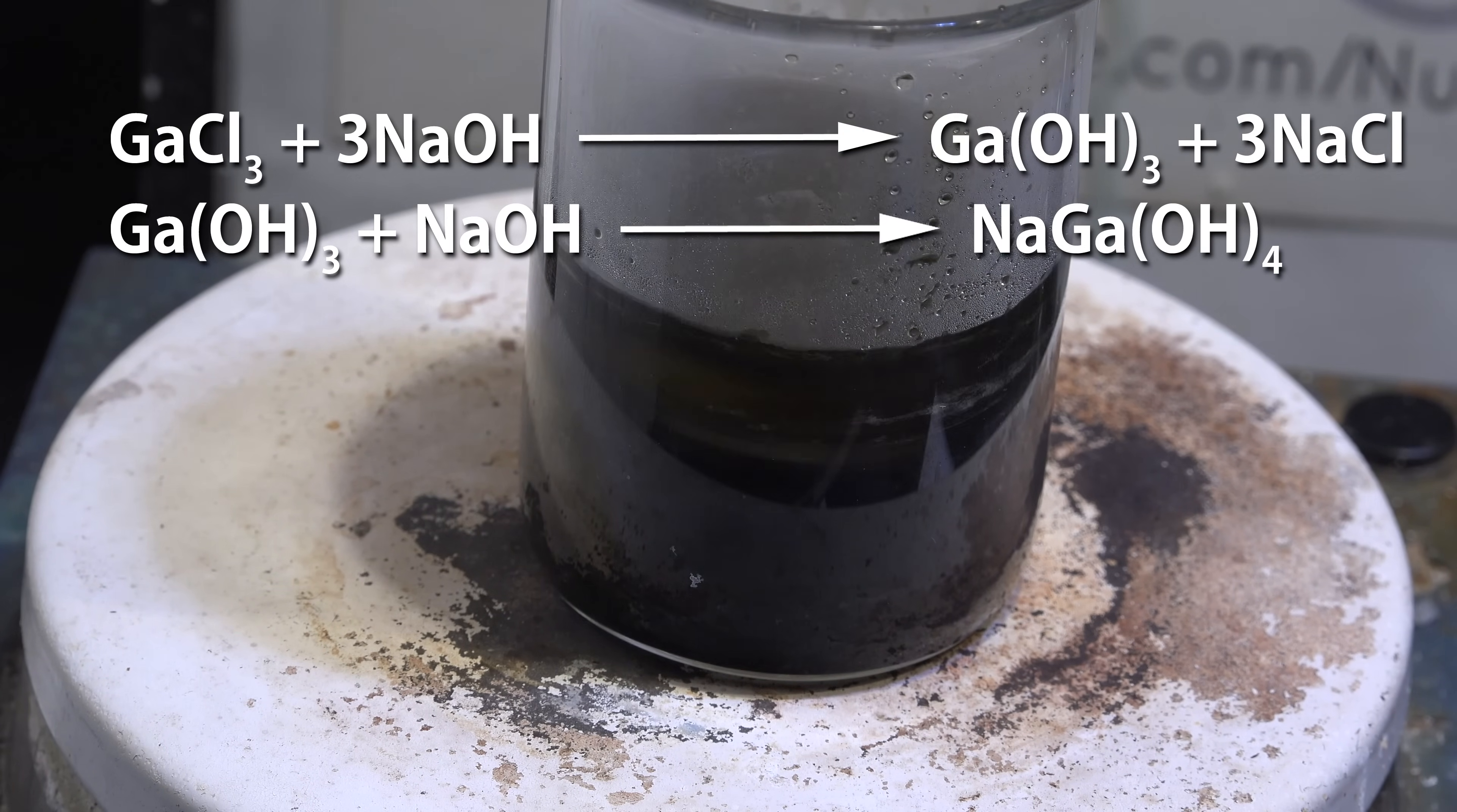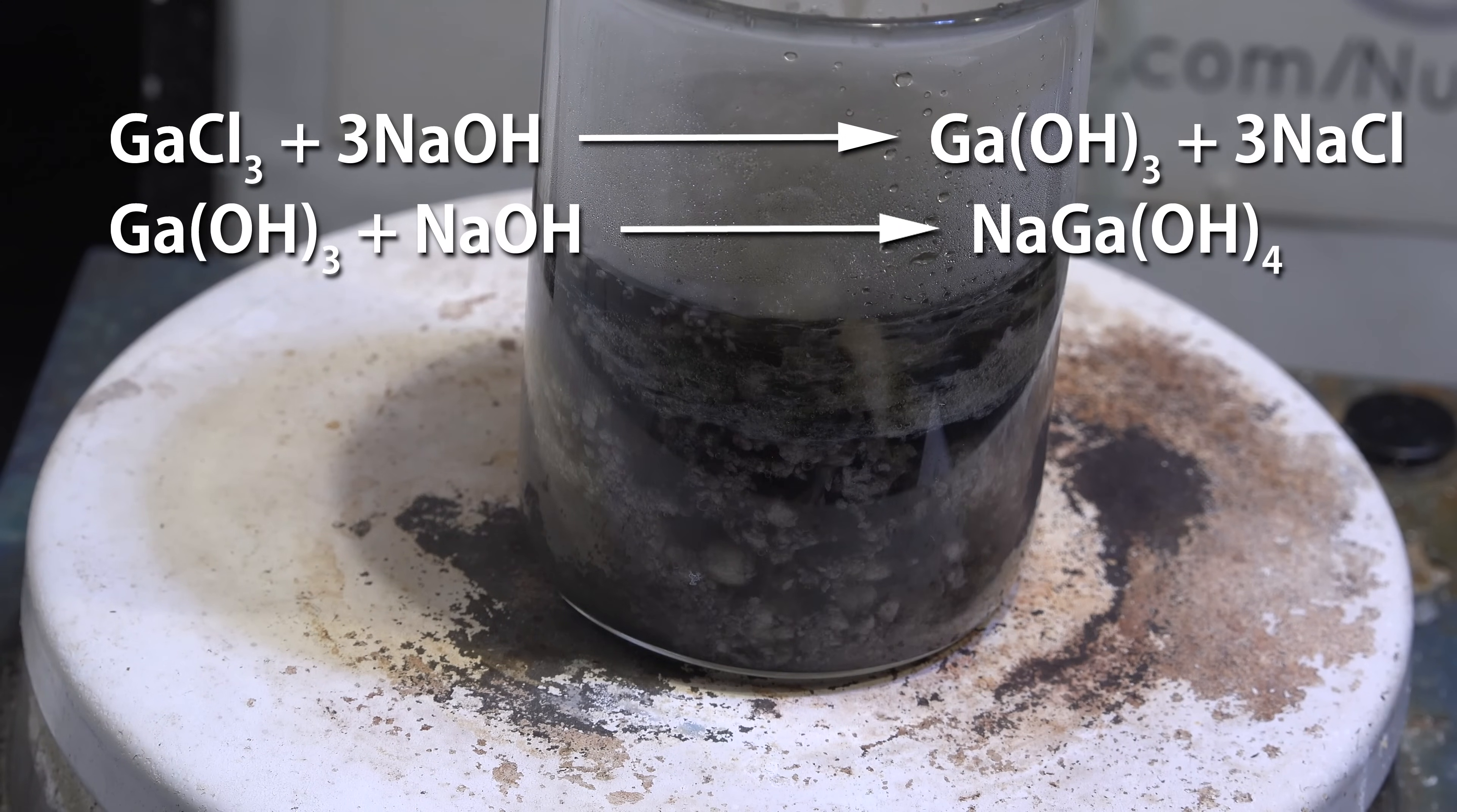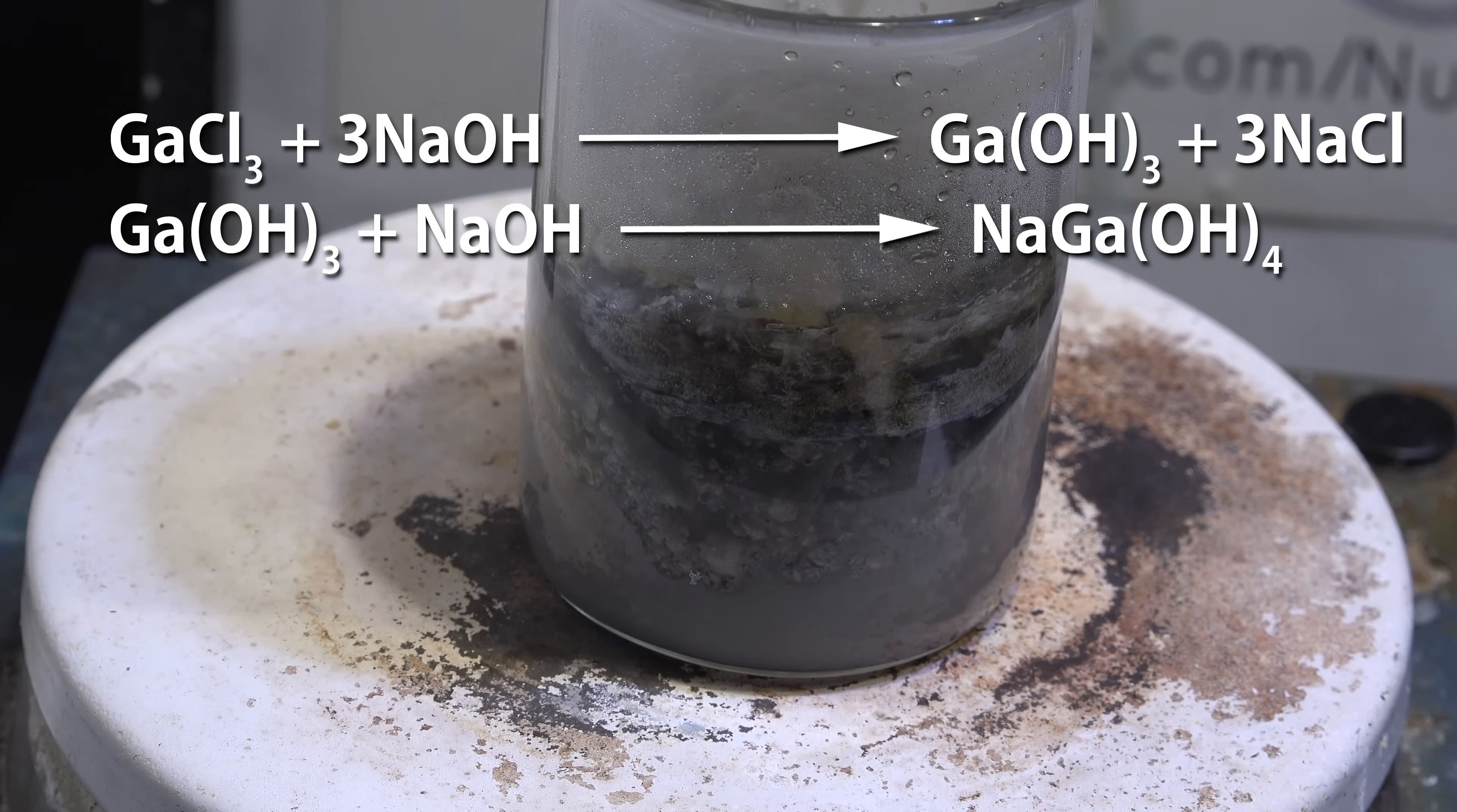But as you keep adding sodium hydroxide it will dissolve again as the sodium hydroxide and gallium hydroxide react to form a sodium gallium hydroxide. It is this stuff that we want so keep going until the precipitate dissolves again.